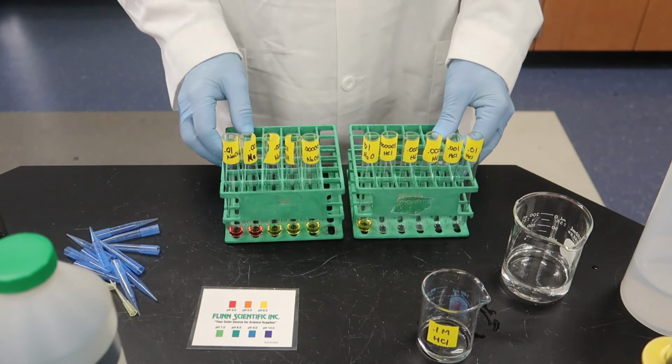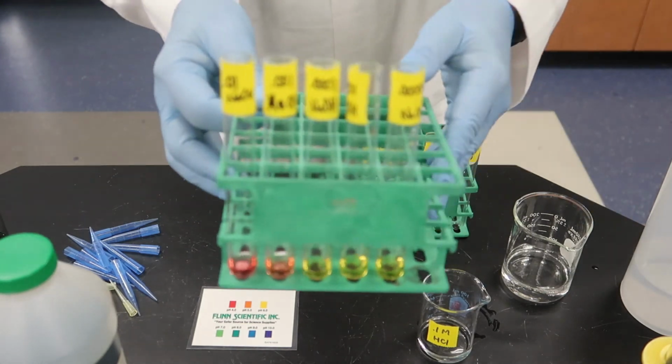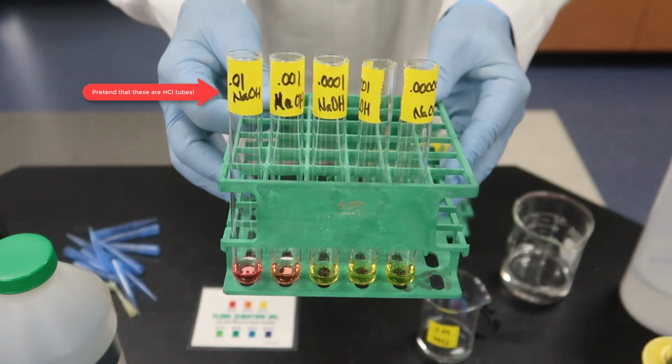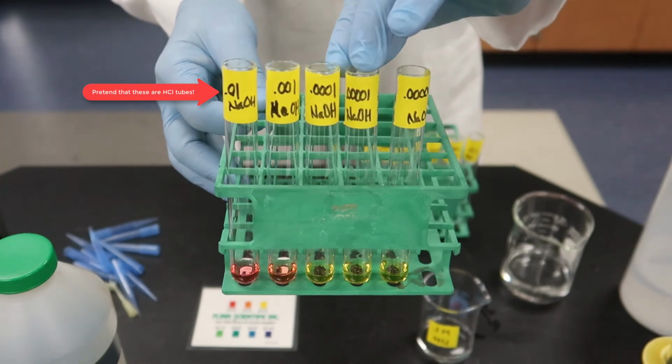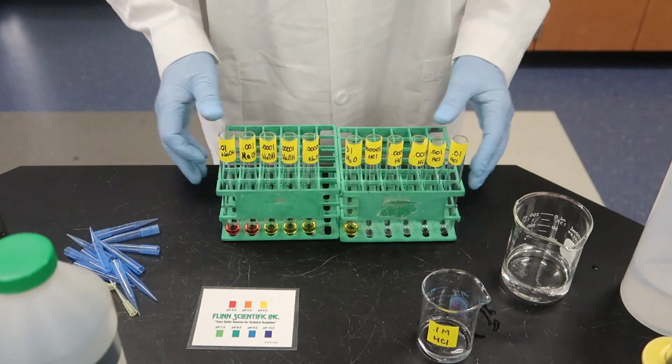So you can see here we have a nice rainbow of red to yellow. If we were to do this with the bases, we would see a similar rainbow, going from green close to neutral to more and more blue and purple.